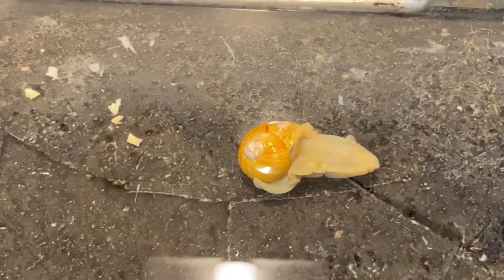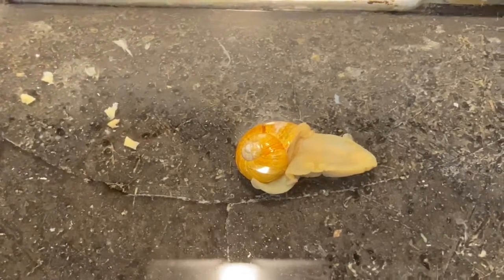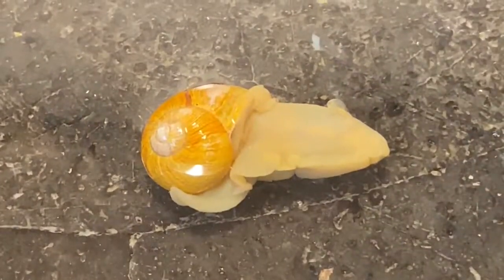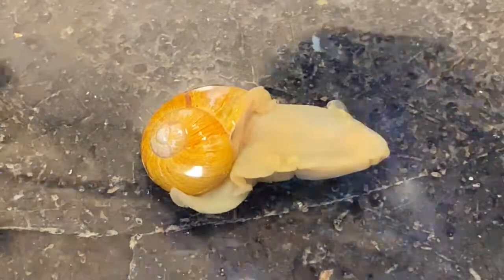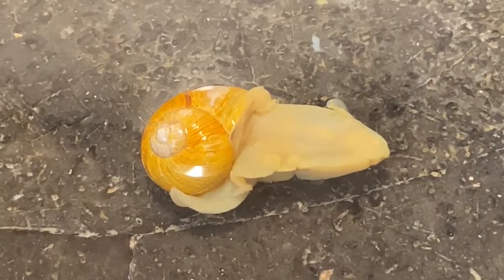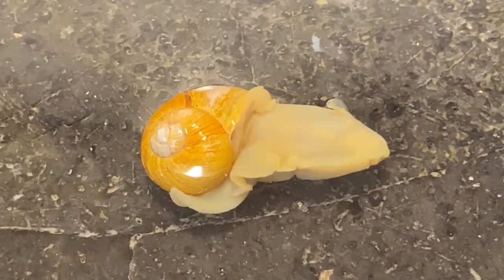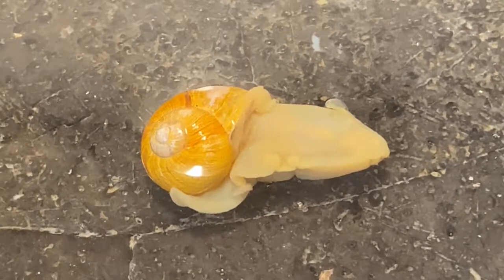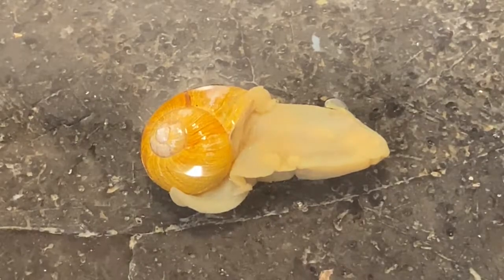In this video we're going to take a look at the common garden snail, genus Helix. This is one that's been preserved, and we're going to take a look at the external anatomy on this specimen.